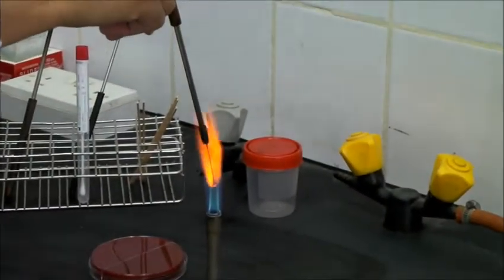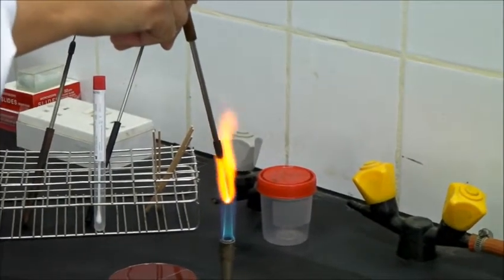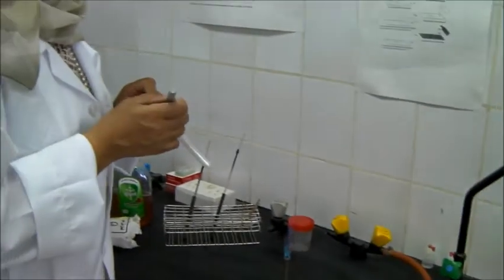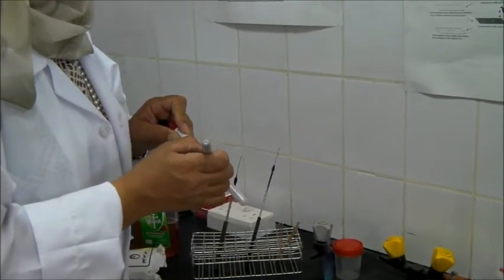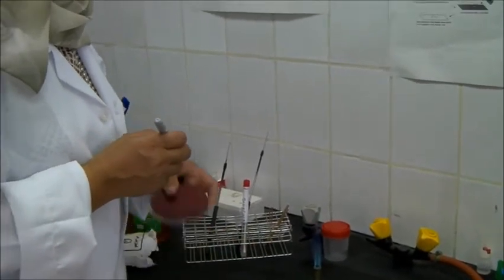Now we label the plates by the same patient number and hospital number, and we place them upside down inside the incubator. For example, the sample number is 50 over 10, 2012 — this is our serial number. We place the plates inside the incubator for 24 hours at 37 degrees aerobically, or we use a candle jar.